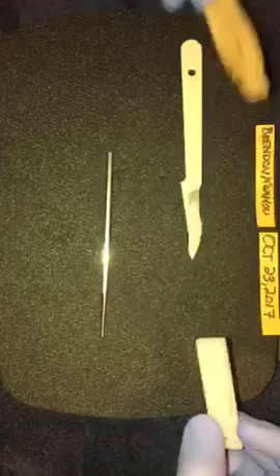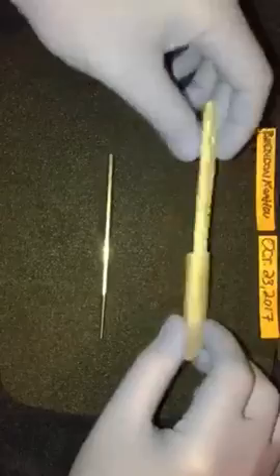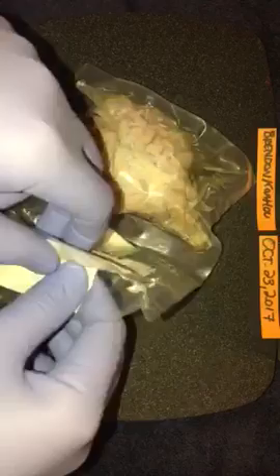I can actually just pull this off — a little sheet of paper, I think that's just for transport. And we're gonna go ahead and open up this brain. Made in Mexico — thank you, Mexican sheep. Muchas gracias for your brain. I'm gonna try and keep this bag as intact as I can because I'm gonna try and put the brain back into the bag afterwards.